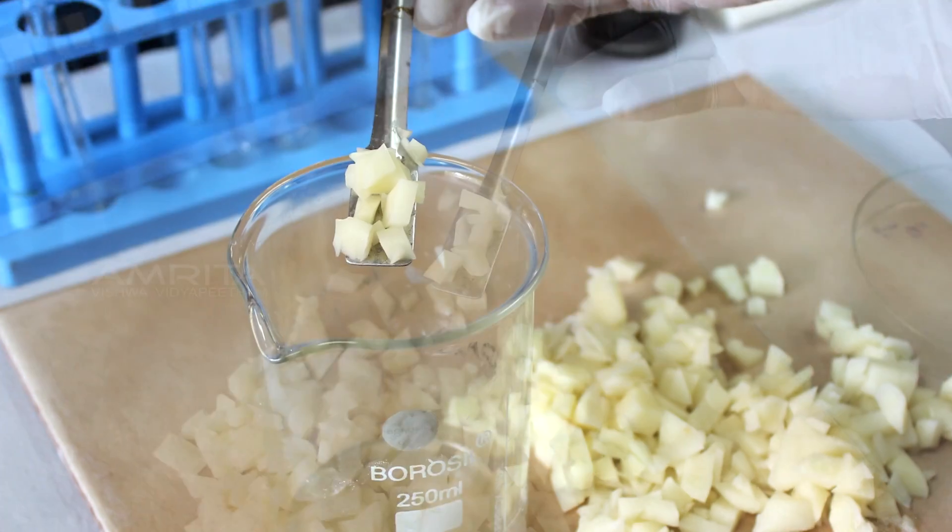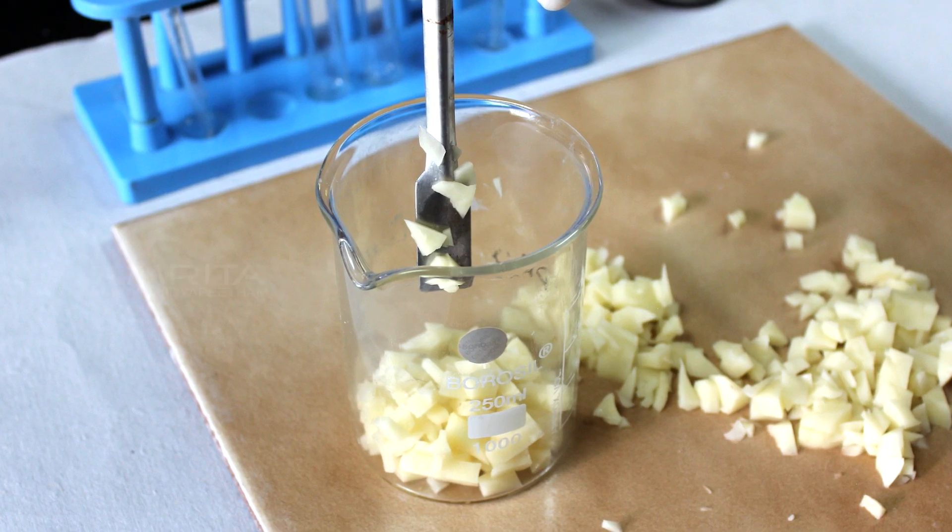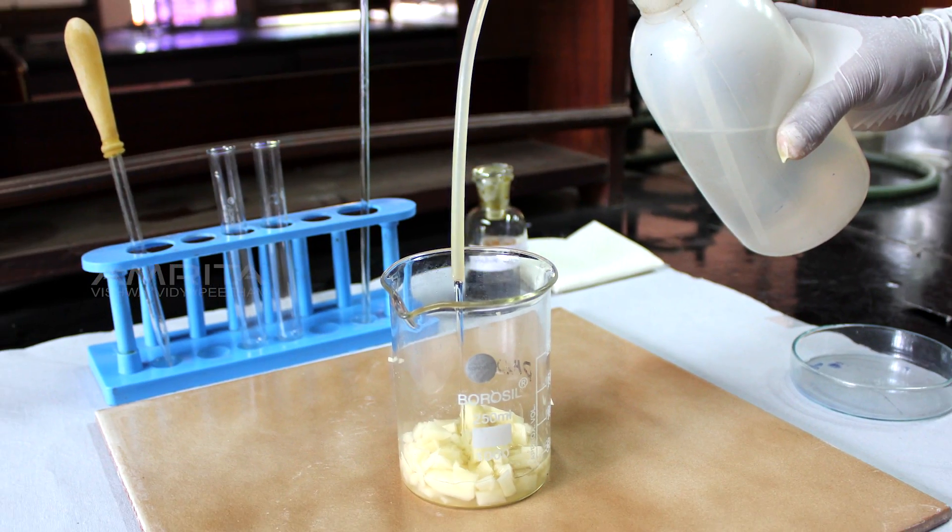Using a spatula, put these pieces of test material, the potato, into a beaker. Add some distilled water to the beaker.